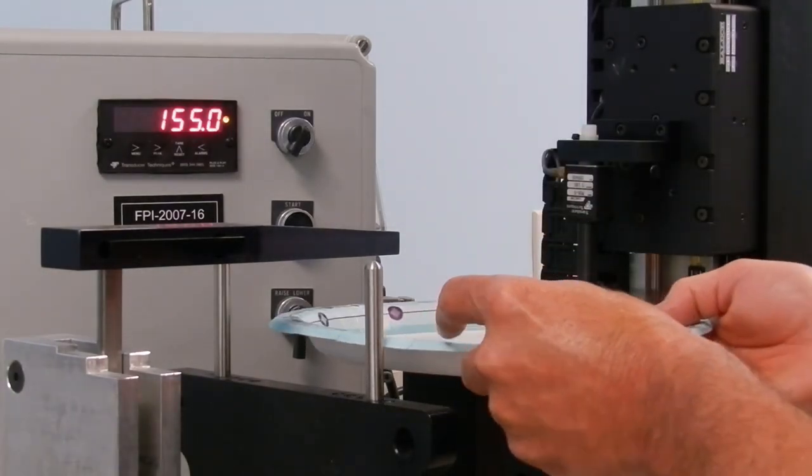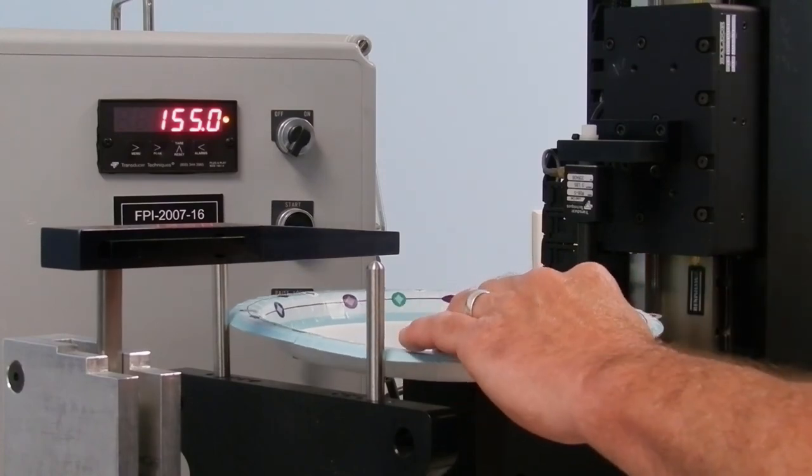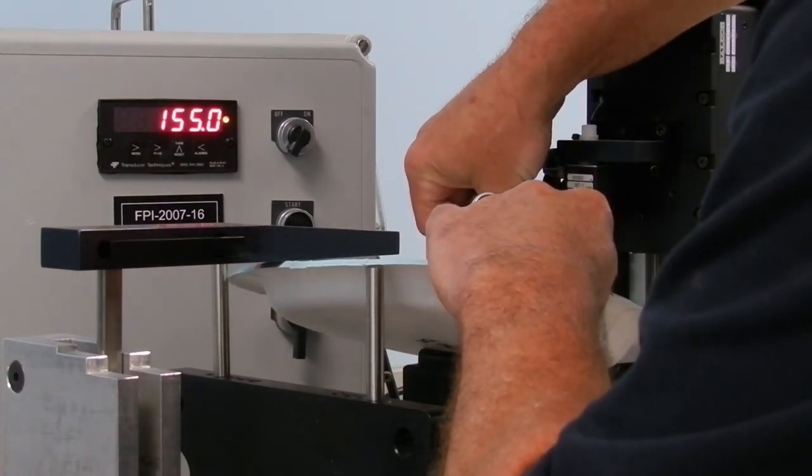The plate is placed on the test stand in the machine direction. The silver pins are used to correctly center the plate on the test stand.